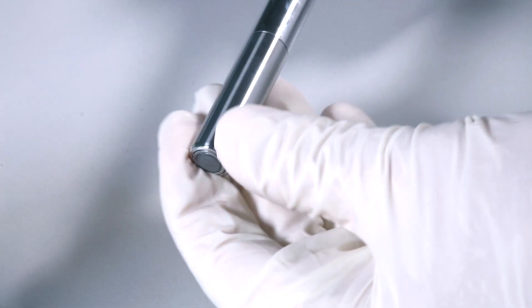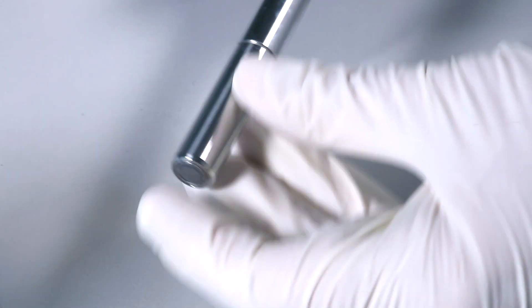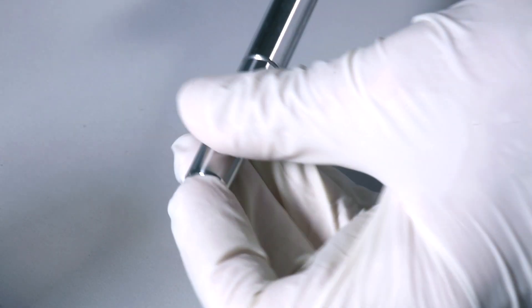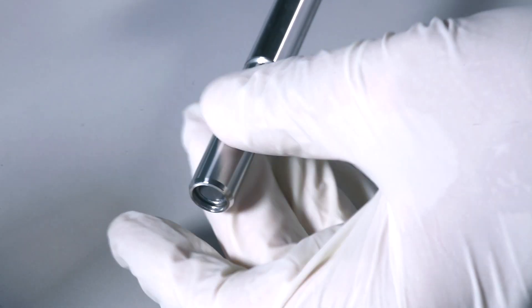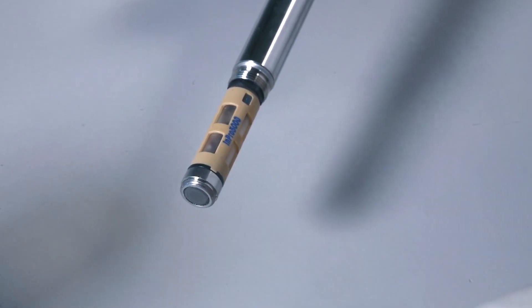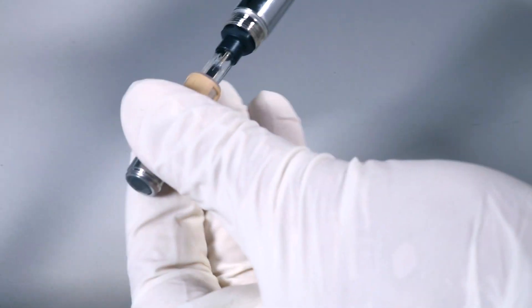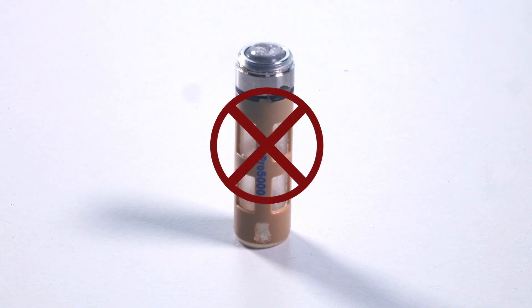First, turn the cap sleeve a few times to loosen it. Gently push the membrane into the sensor to release it from the cap sleeve. Unscrew and remove the cap sleeve. The membrane body can then be pulled off the sensor tip. Do not reuse the membrane body. Dispose of it appropriately.